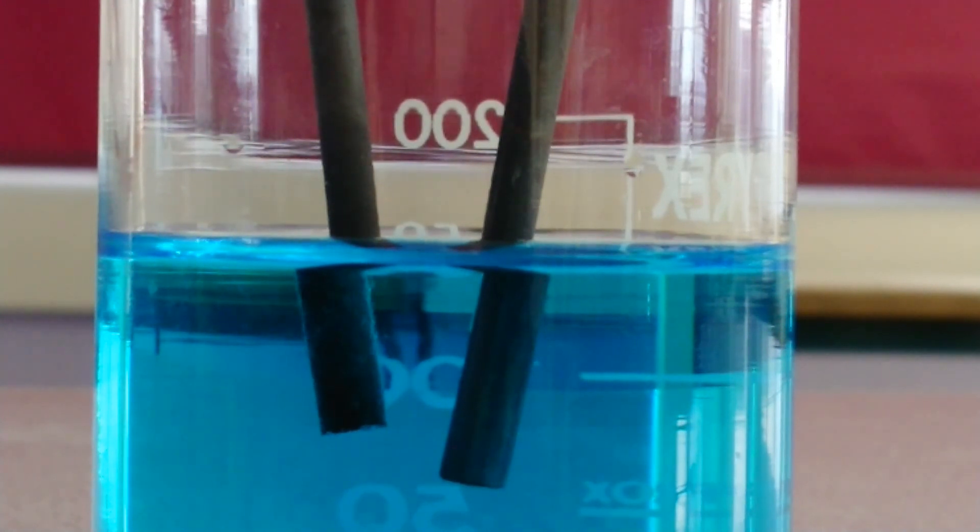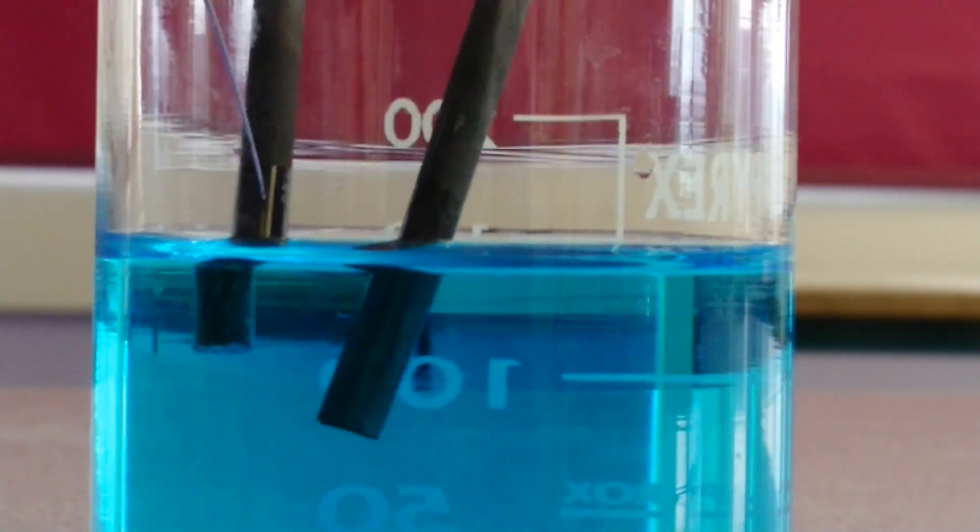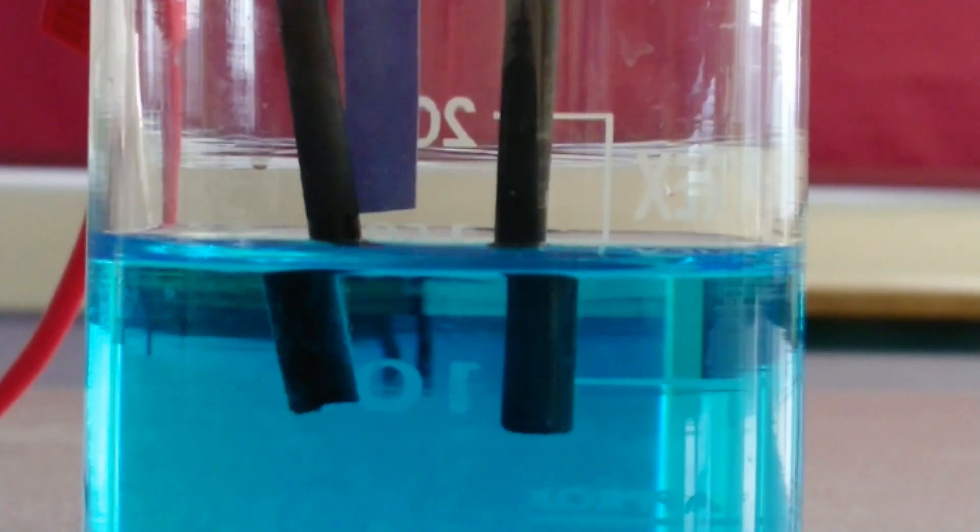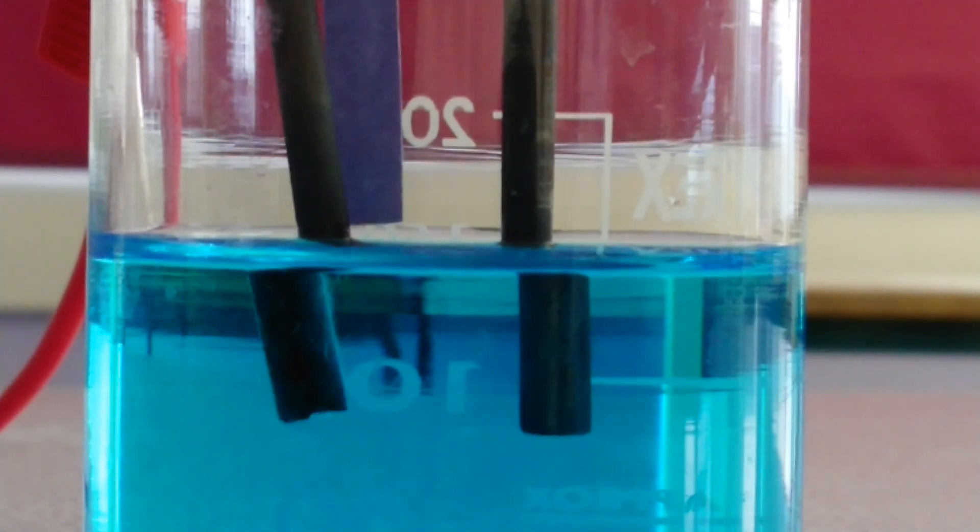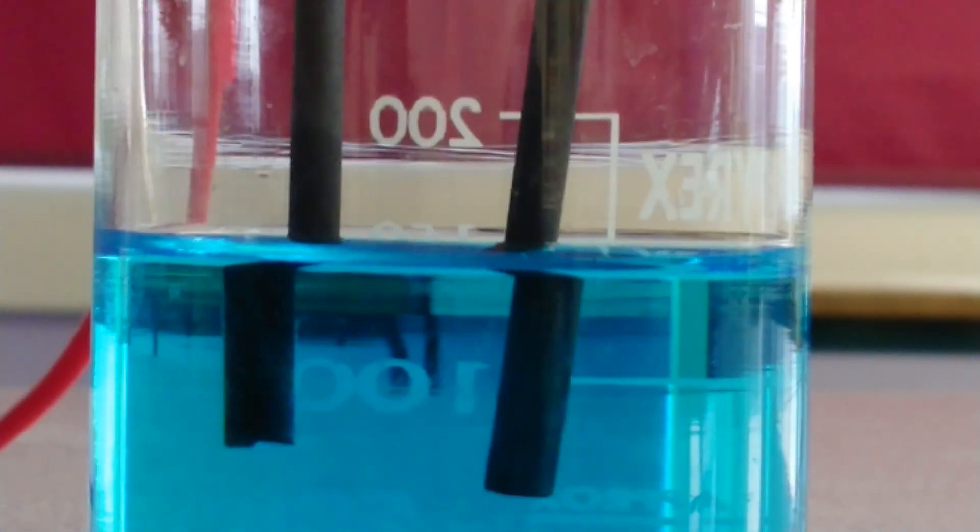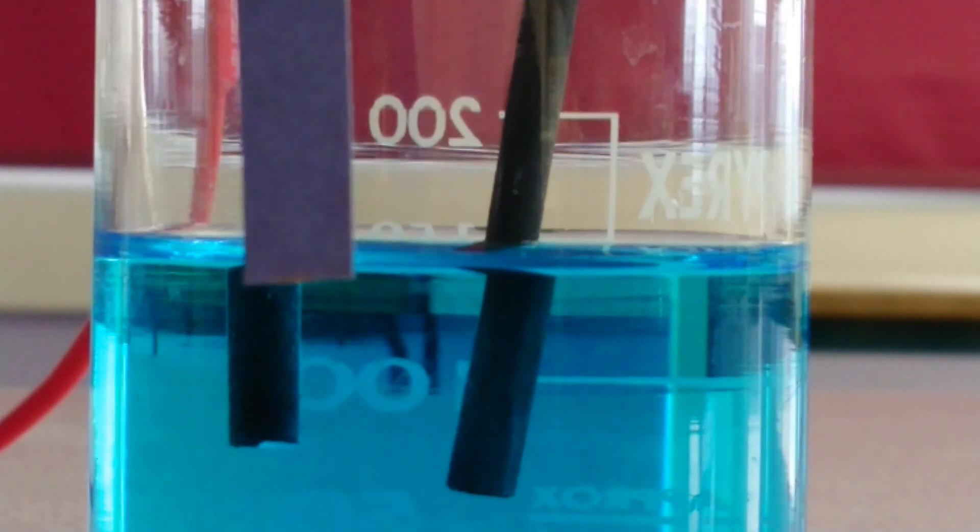This time we can see that it's having no effect on the litmus paper at all, so that tells us that we've got oxygen being given off.